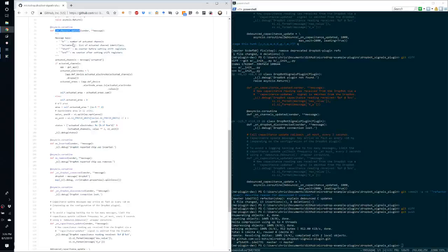The on channels updated is doing a little bit of calculation here just to get a reference to the currently loaded device file, and then get the actuated electrodes. So given the channels that are actuated, which are the corresponding electrodes? And then given those electrodes, look up the areas of those electrodes to find out the total actuated area combined. And then just log out a message that displays that in a pretty way: the list of actuated channels as well as the total actuated area.